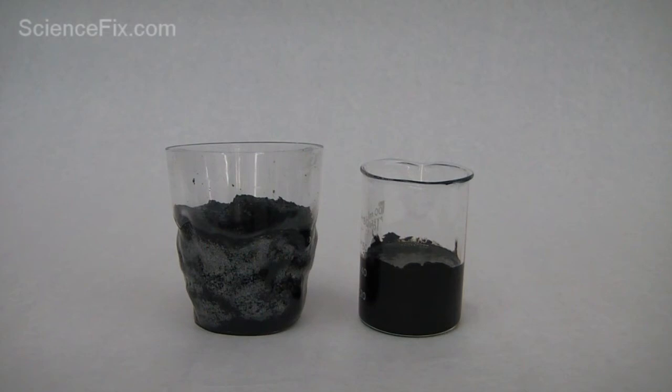In this case, the carbon is going to be generated as a solid, and it looks like it's going to rise up in the beaker container. And it's a pretty stunning chemical reaction, and when you show this to students, they're really taken aback by it.